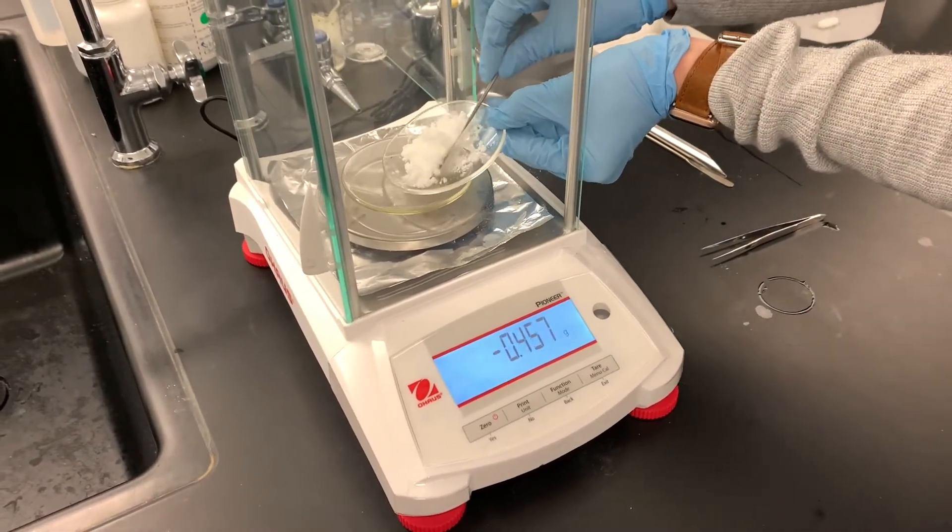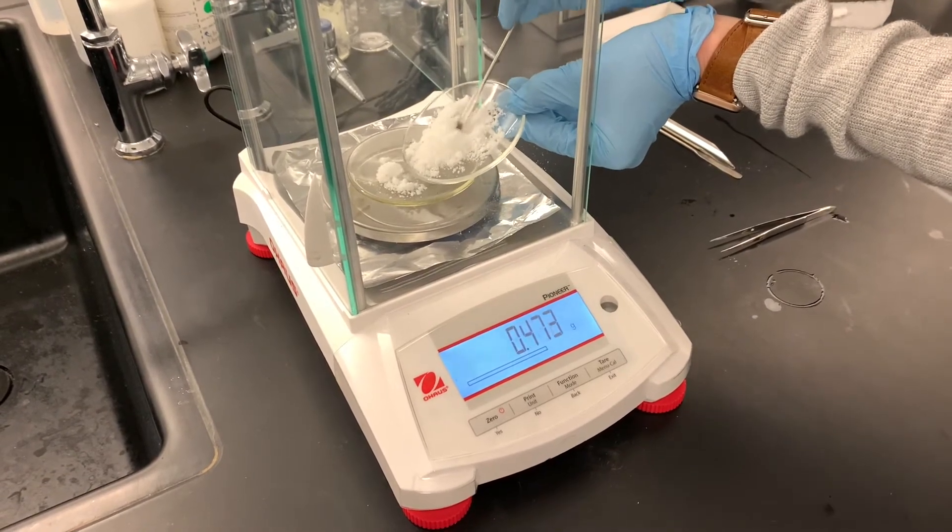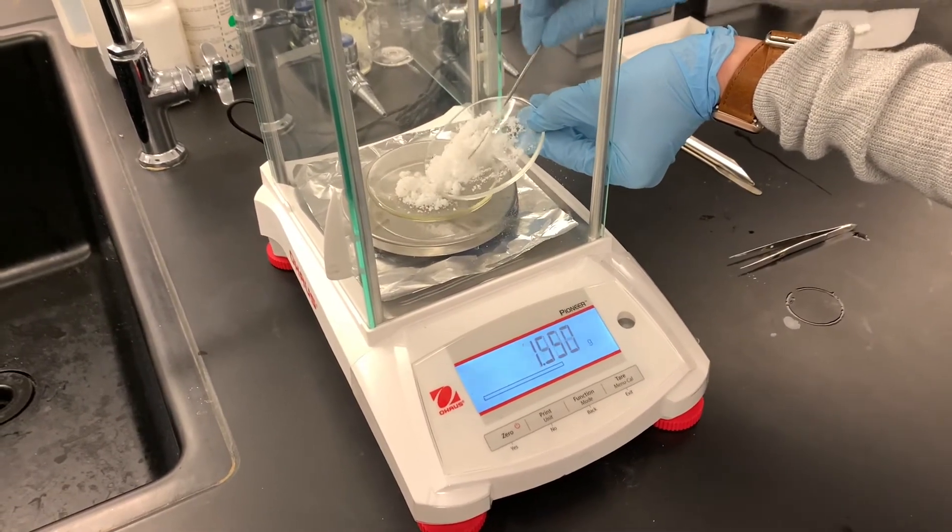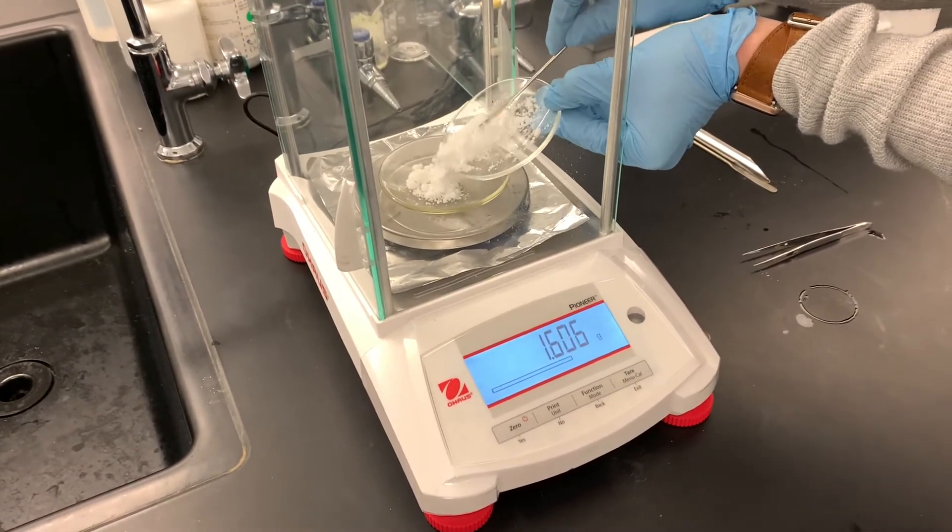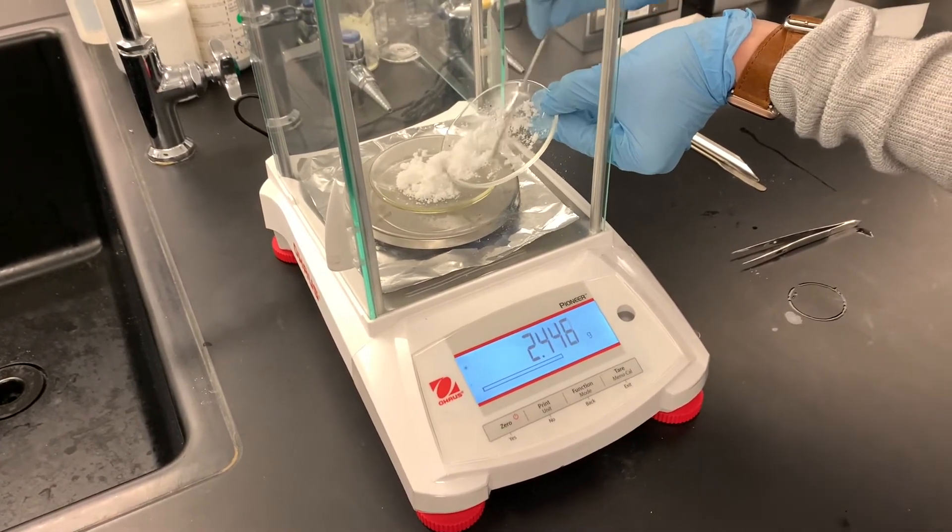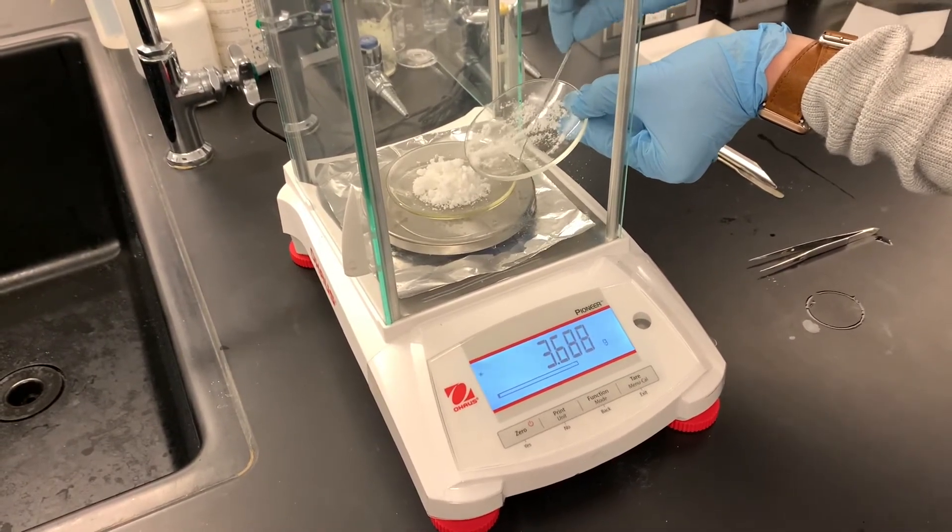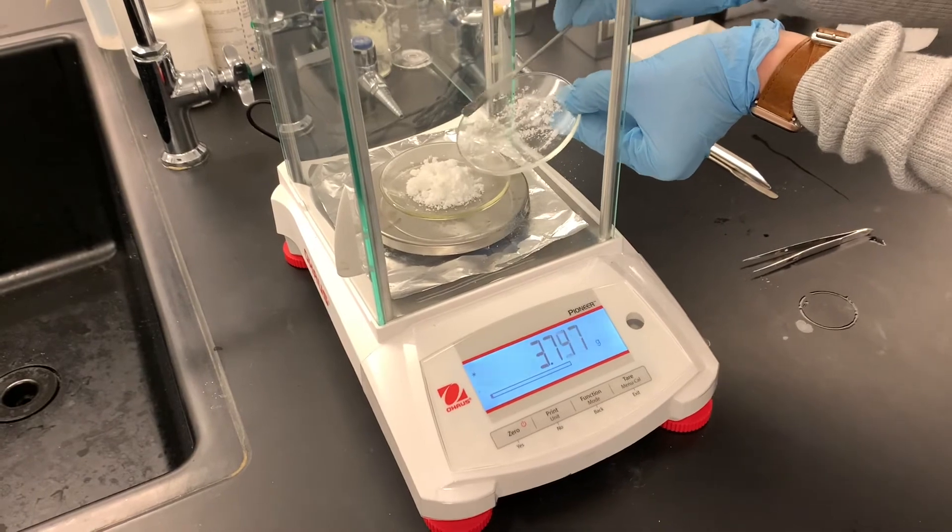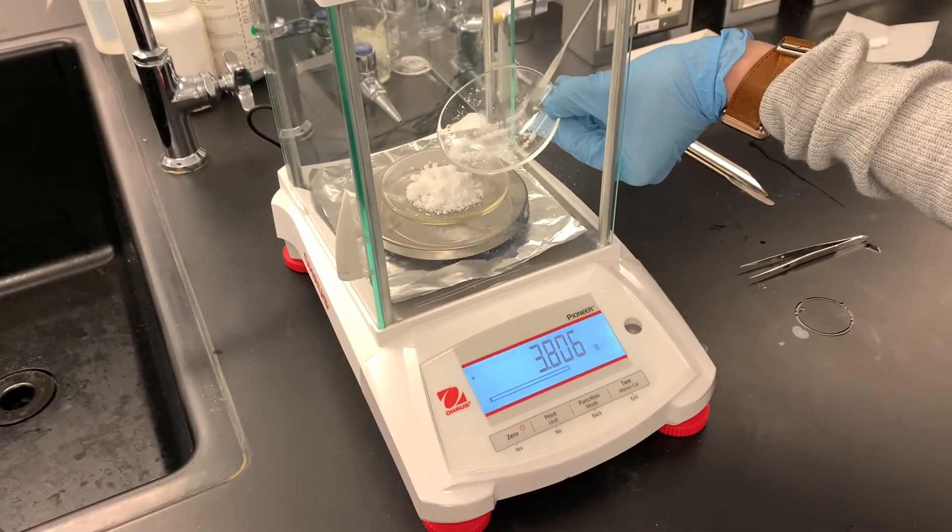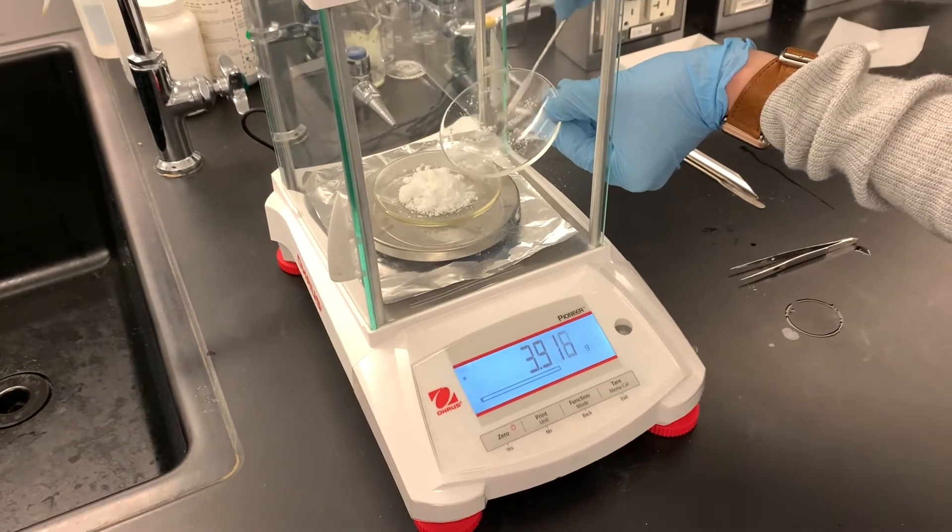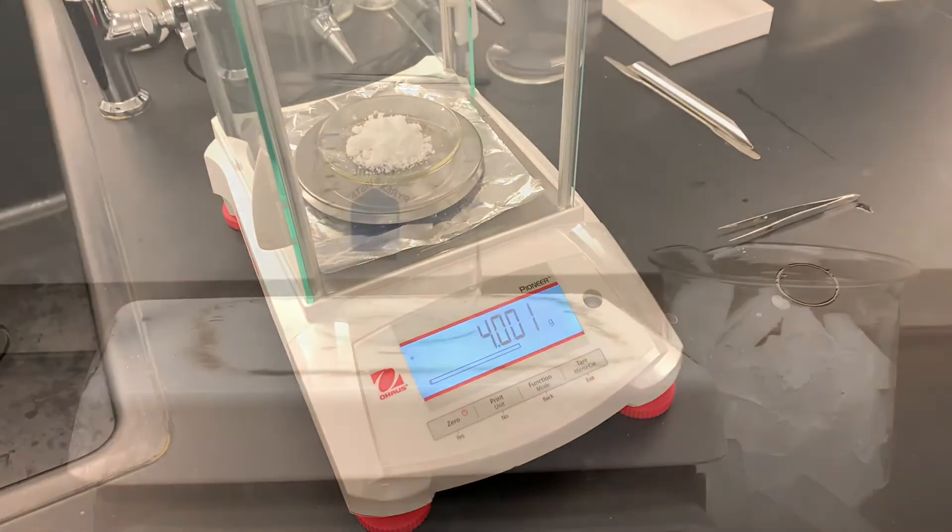This smells very strong, not quite as strong as the isoborneol. It's got a real kind of medicinal smell, a little bit minty. It kind of makes my eyes water a little bit. Here's our mass of crude product.